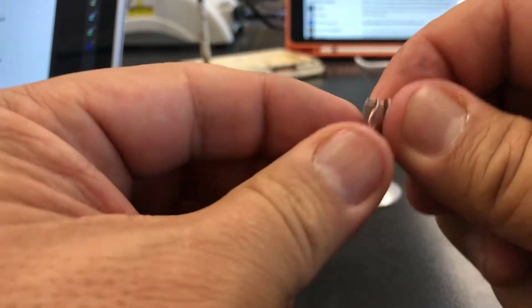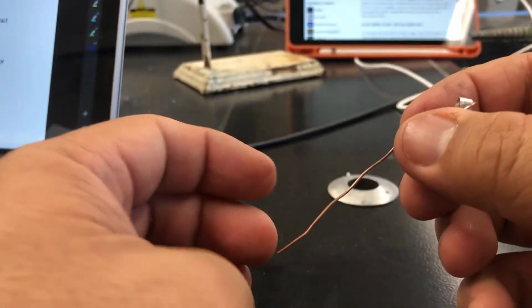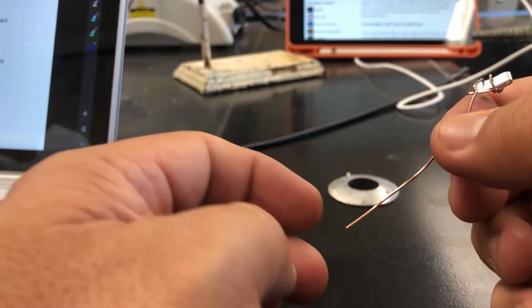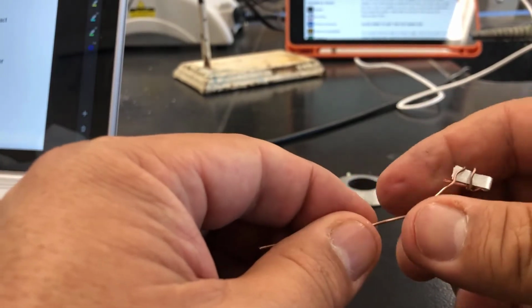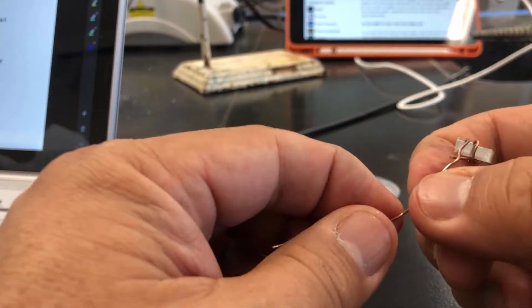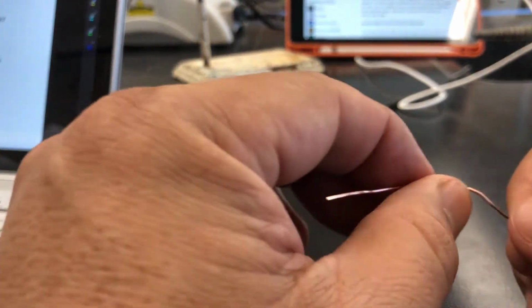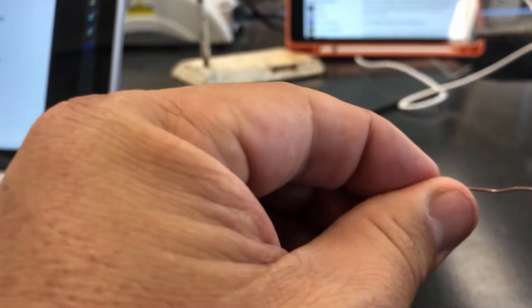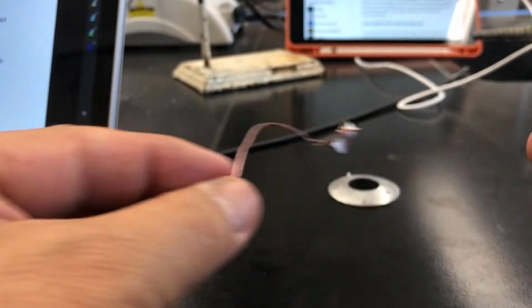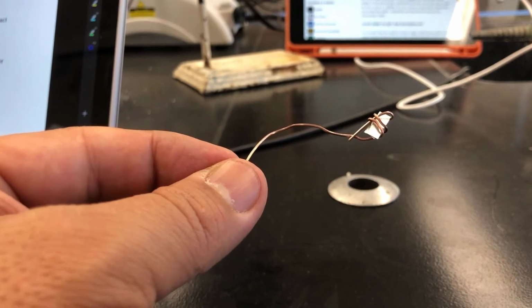You don't want to make it too tight, because you need to let the hydrochloric acid react with it. But you also have to make sure it stays in the tube. The other thing that I'm going to do is put a little kink in here, because in the tube you don't want this copper wire to fall out. So there needs to be a little bit of pressure from the copper wire inside the tube to hold it in place. And something like that will typically work. Okay, so we'll go ahead and test it out and see how it works.